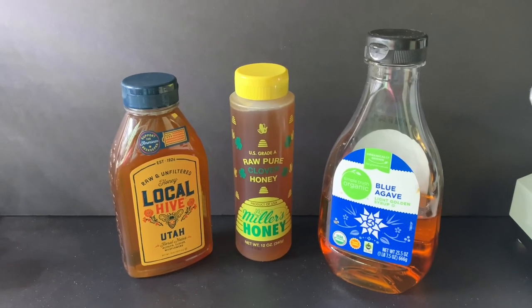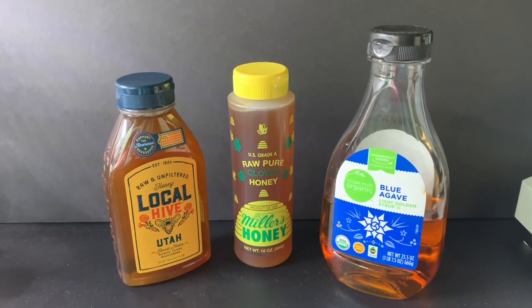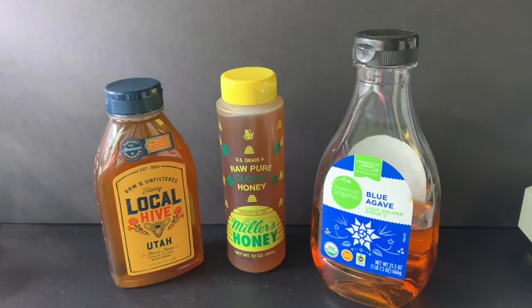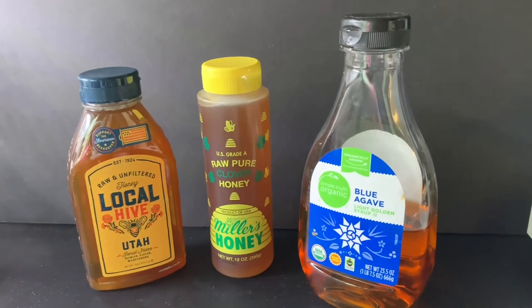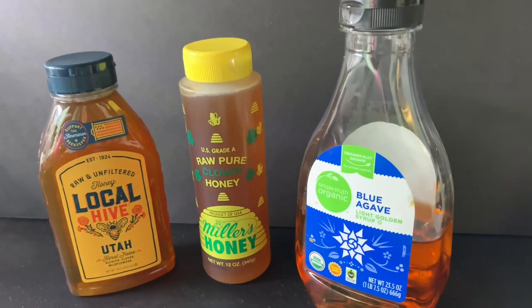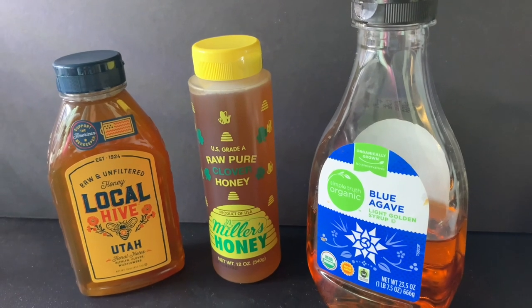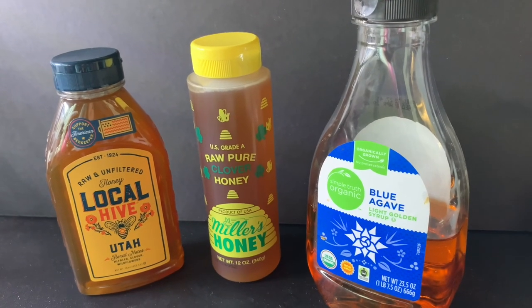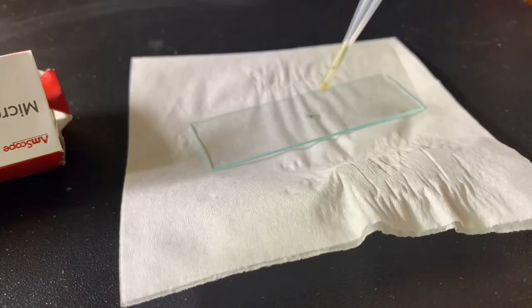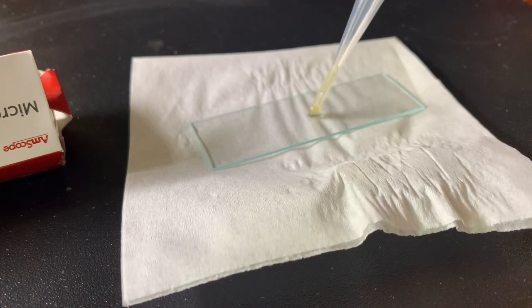Hey everyone, welcome back to Fantastic Microbes and Where to Find Them. Today we are going to be looking at honey and agave under the microscope. I've gotten a lot of requests to look at foodstuffs under the microscope and I figured this would be a great place to start because sticky substances like these can tend to capture a lot of things in their environment.